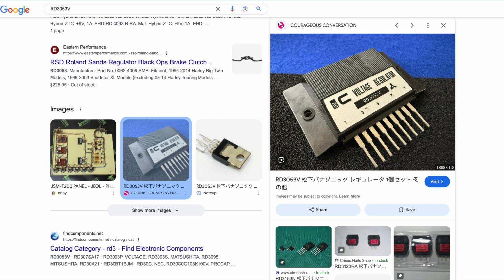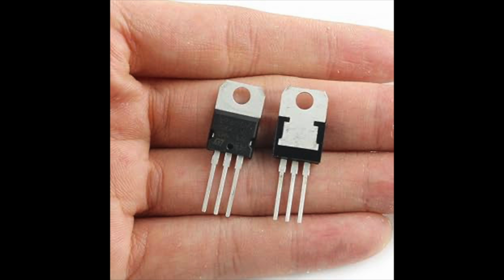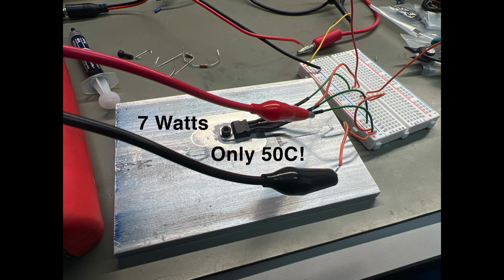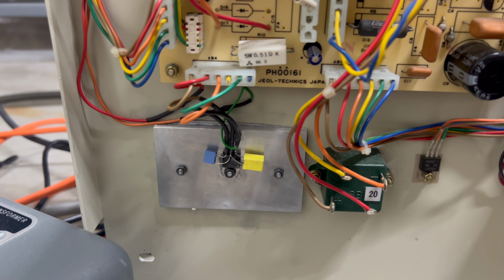Now, this part is so old that I couldn't get any relevant info on it. I ended up using a bench power supply to provide 5 volts manually and found that the machine drew about 1 amp. The common 7805 linear regulator can do that much easily. However, this little package cannot dissipate the excess heat without a better heatsink, so I made one out of an aluminum plate and some thermal paste. I wasn't sure if it could handle the power dissipation, so I tested it on my bench. Surprisingly, dissipating 7 watts of power only raised its temperature to about 50 Celsius. I went ahead and mounted the new regulators and wired everything back together.